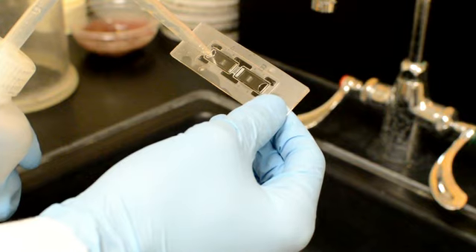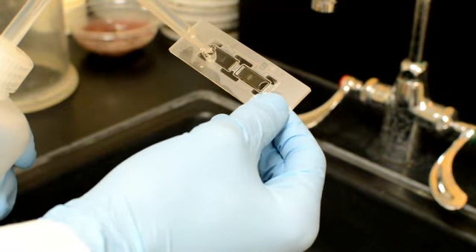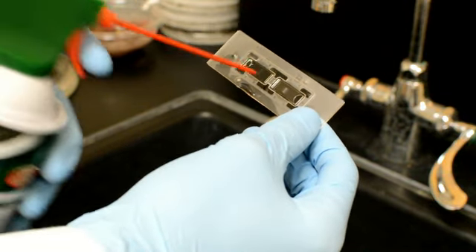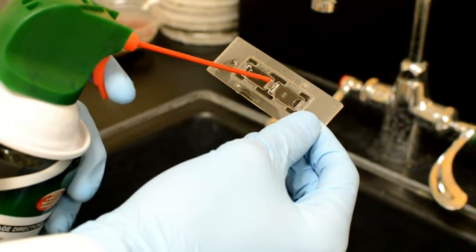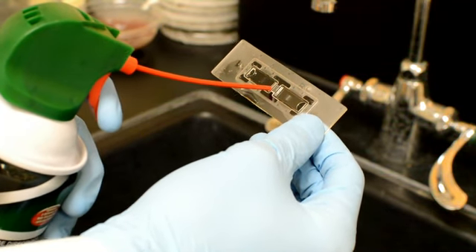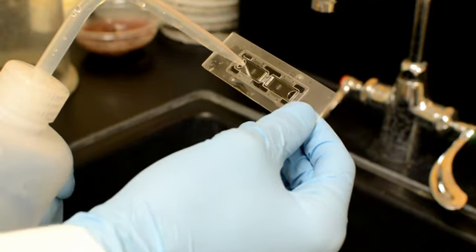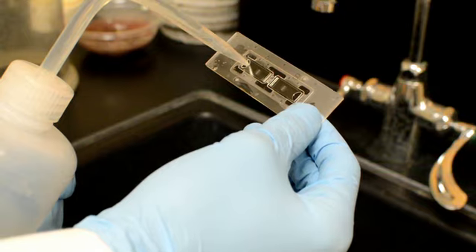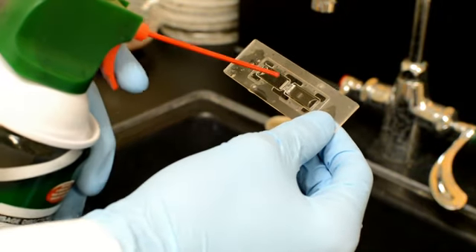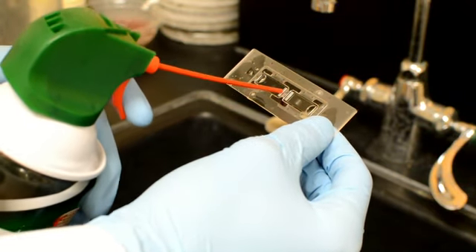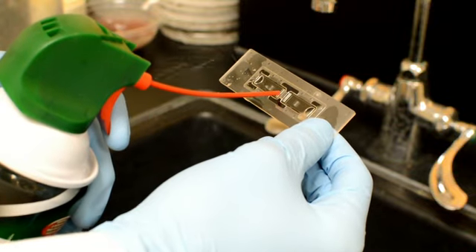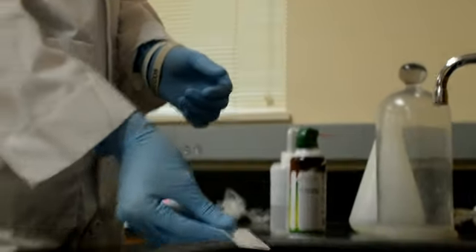Right now, we need to clean our hemocytometer. While these slides are disposable, cleaning them for reuse is very simple. Place the nozzle of your compressed air can into the overflow space of the hemocytometer. Now eject the sample by spraying the compressed air. Next, rinse the counting chamber by squirting deionized water into the loading zone. Using the compressed air, clear the sample chamber again. Repeat this process two more times and set your hemocytometer to dry on a paper towel.